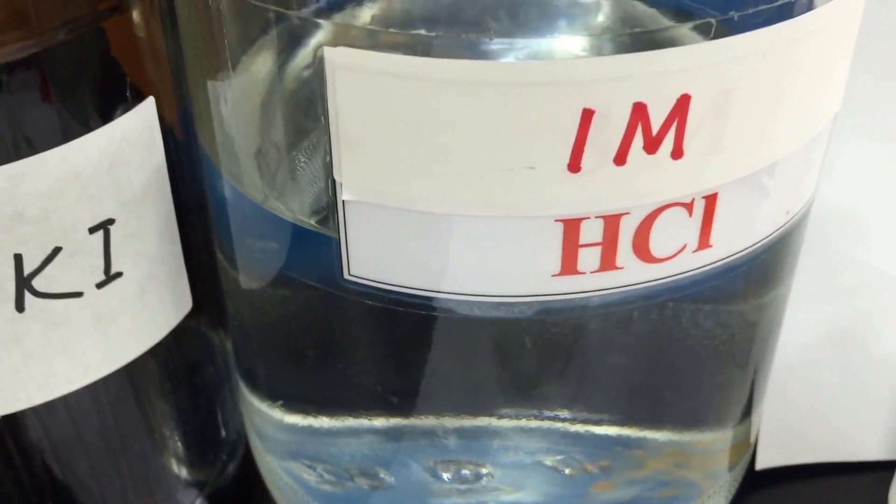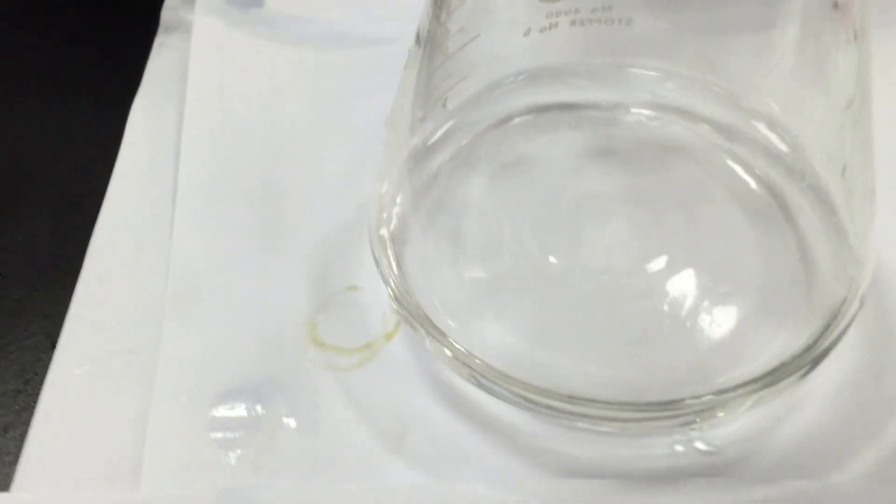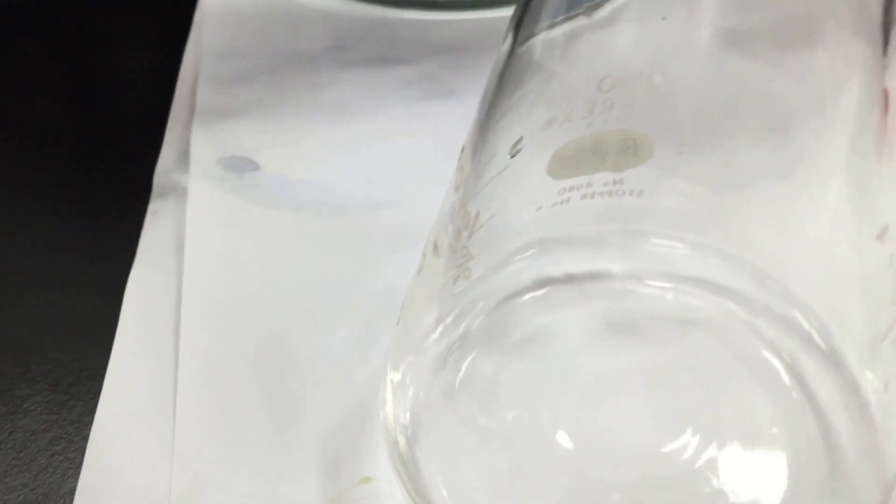So we've got one molar HCl, and this is just excess, so it's approximately five milliliters, and hopefully you'll see a sign of a chemical change here as soon as this is added.